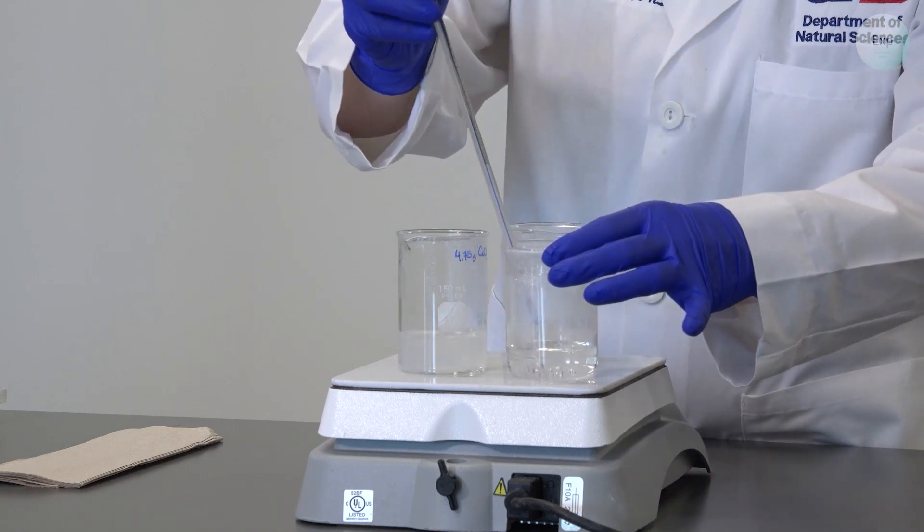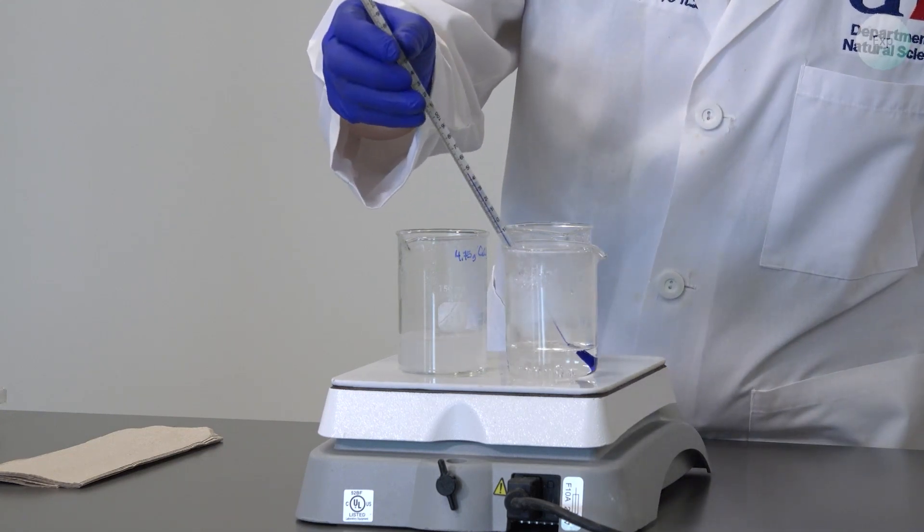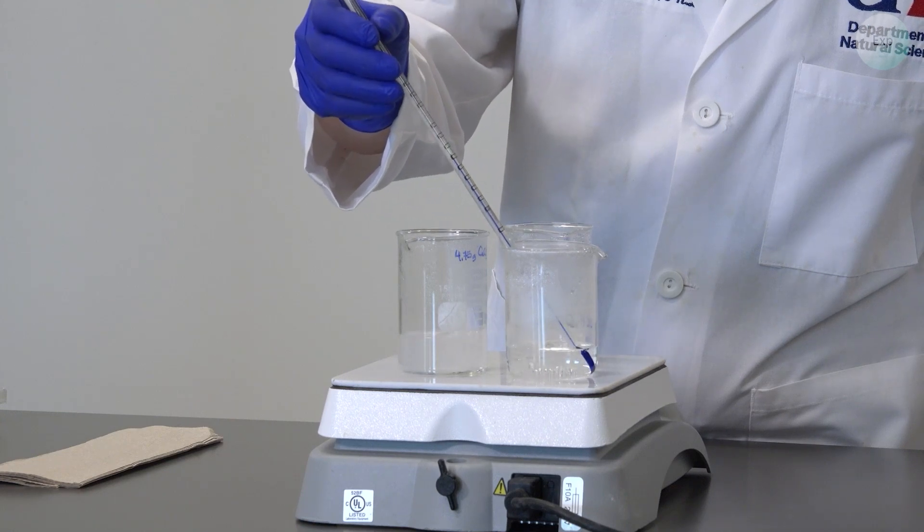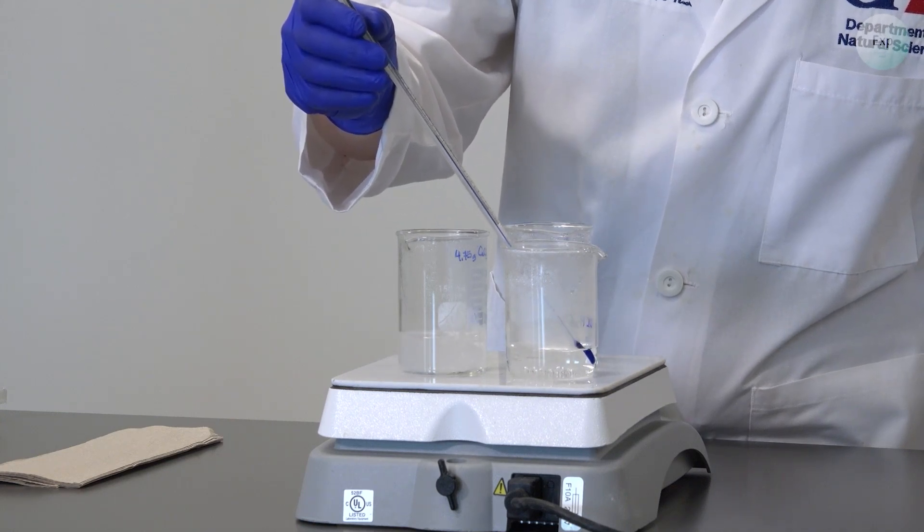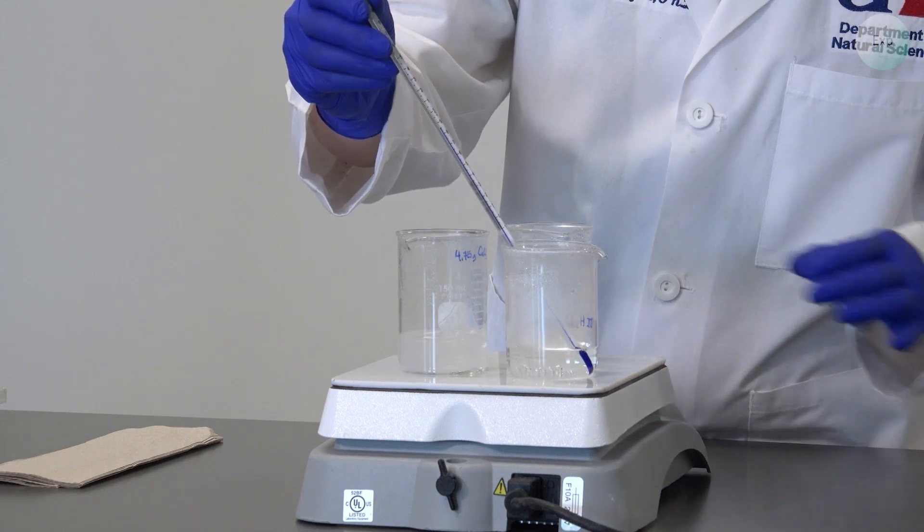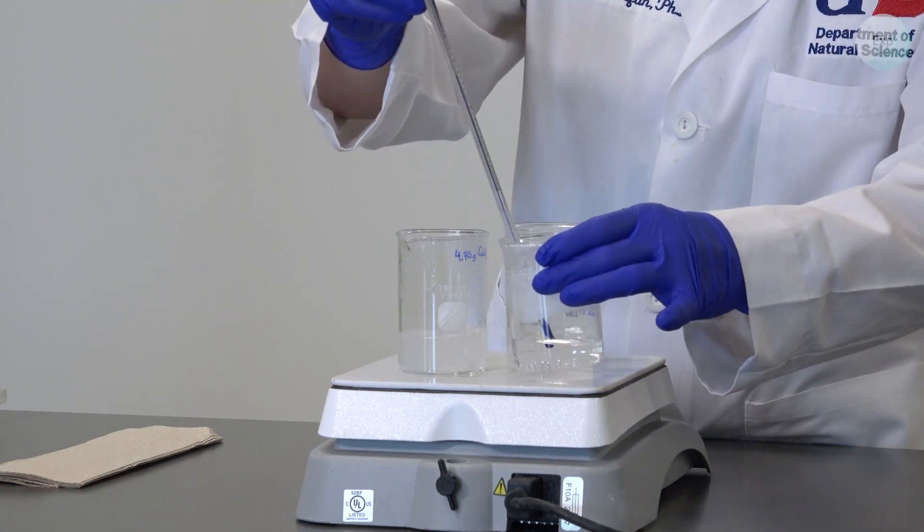We're going to begin with the water and we are going to submerge the bulb of the thermometer inside the water trying not to touch the bottom of the beaker which may record partially the temperature of the top of the hot plate.